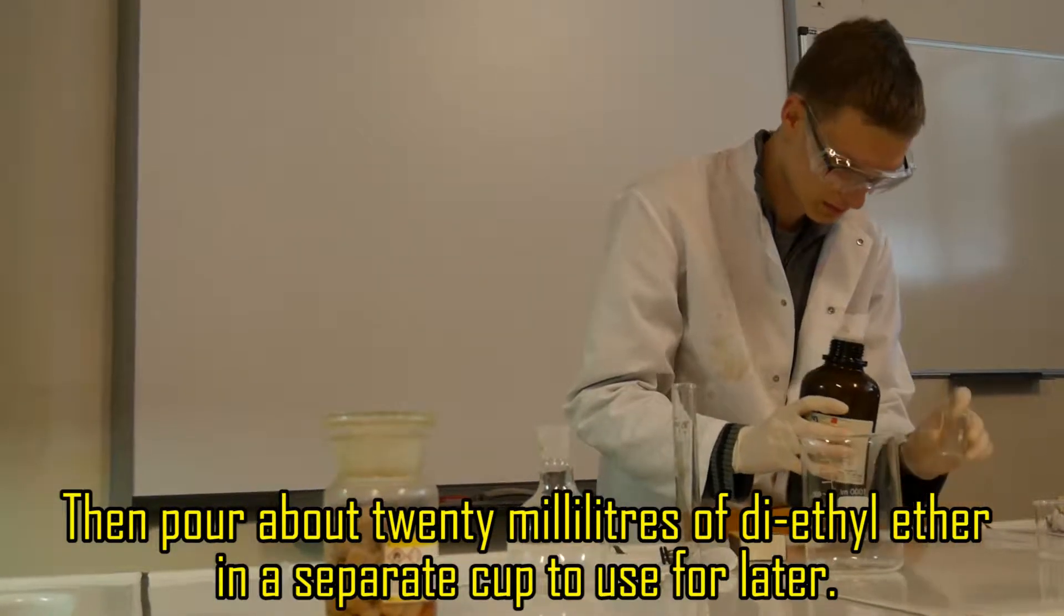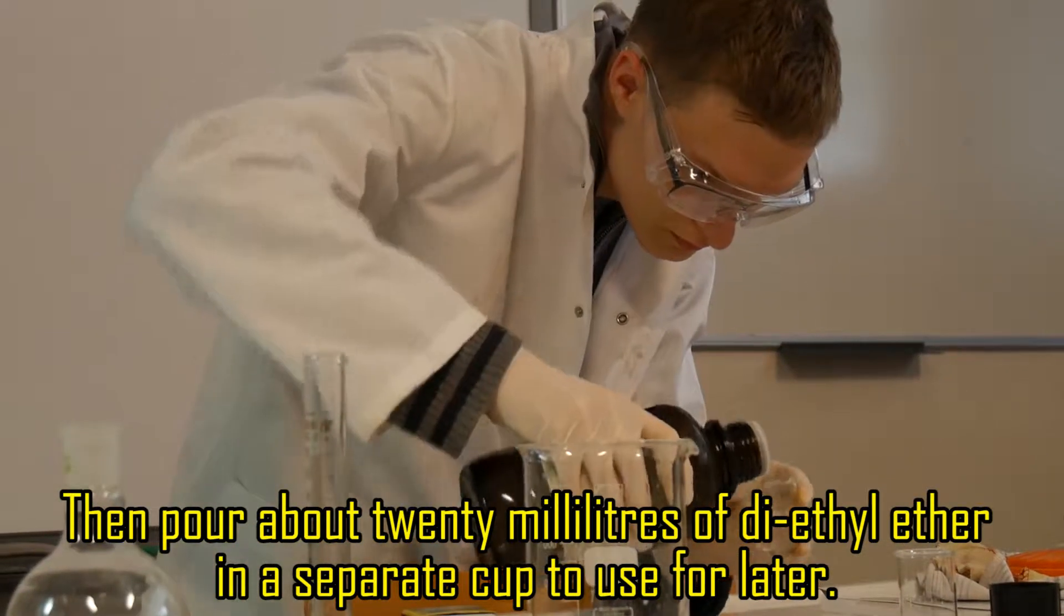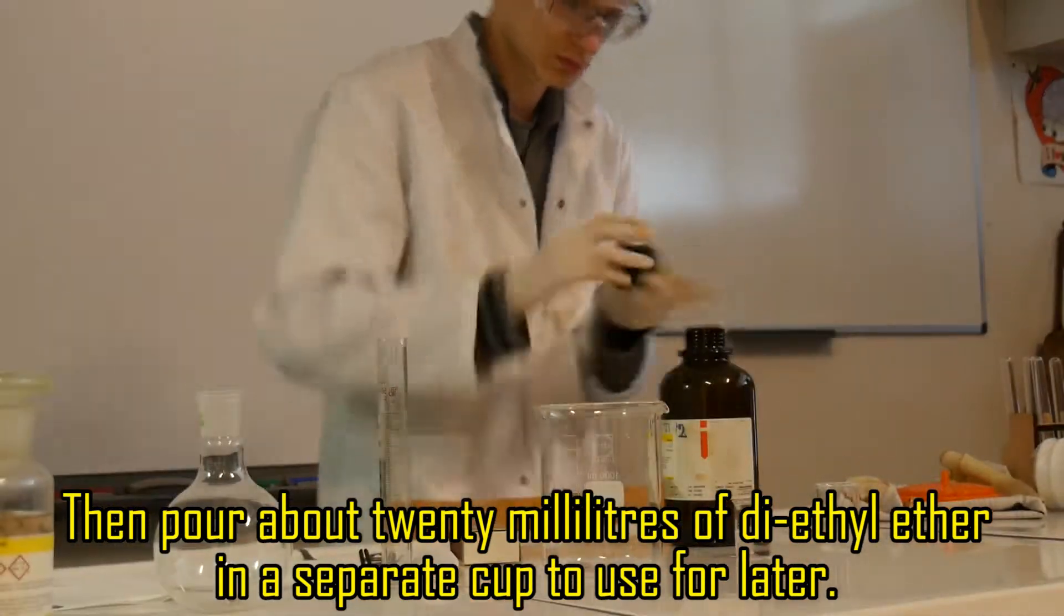Then pour about 20 milliliters of diethyl ether in a separate cup to use for later.